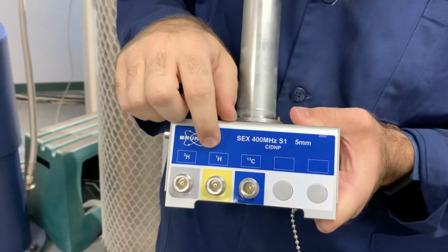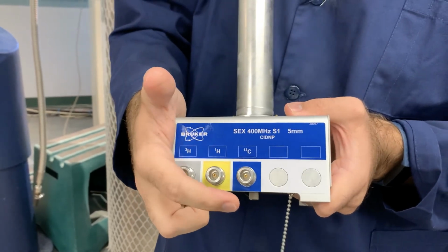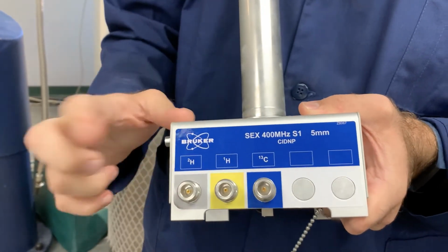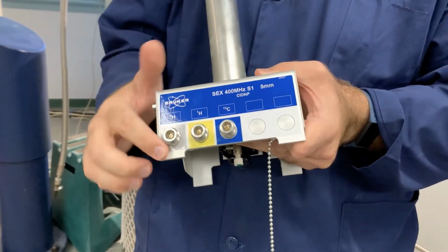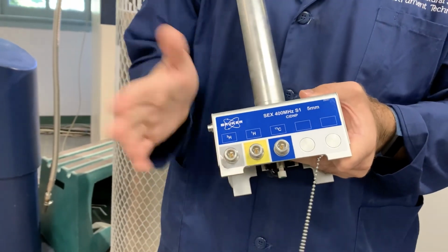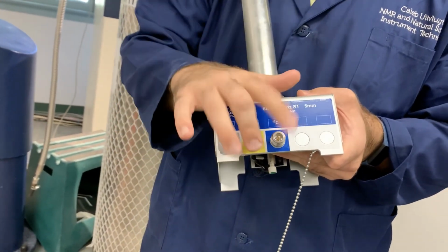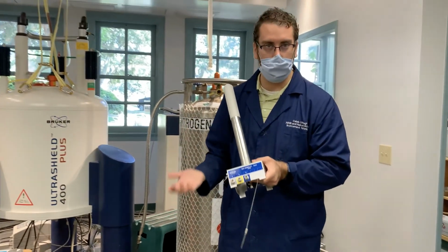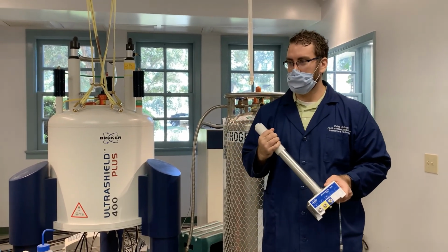So on this one, you can see we have one for hydrogen, so we can look at our sample. We have one for carbon, which is really useful for looking at organic samples. And we have one for deuterium. So how this probe is set up is we have the deuterium as kind of a stabilizing probe, because we have to take a bunch of measurements and then average them. That's called the lock channel. And then we have these 2 that we can measure with, the hydrogen and the carbon. So we can do experiments that look at both. And that's a bit of an introduction to NMR.